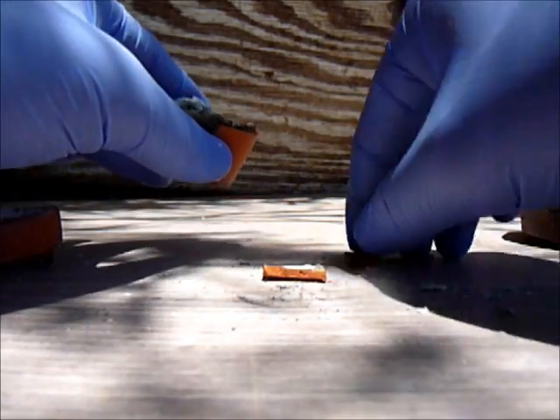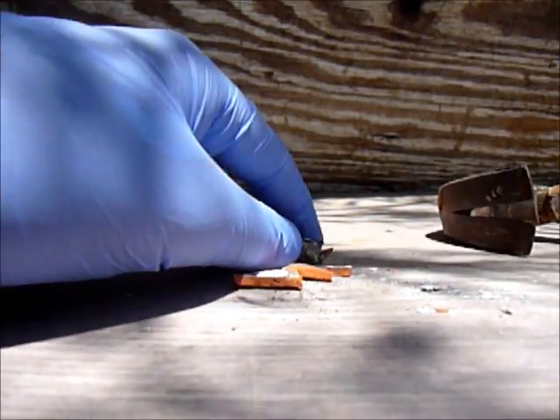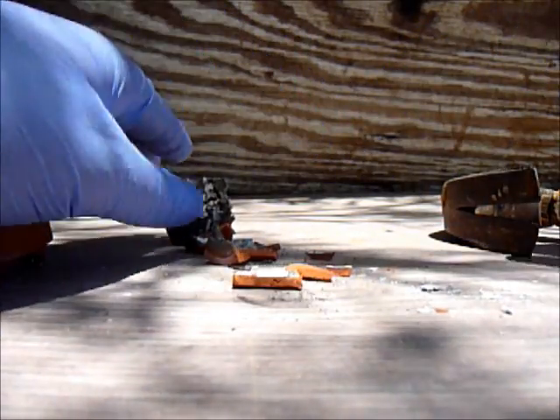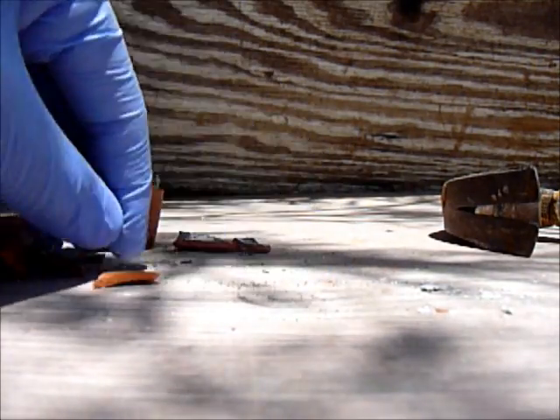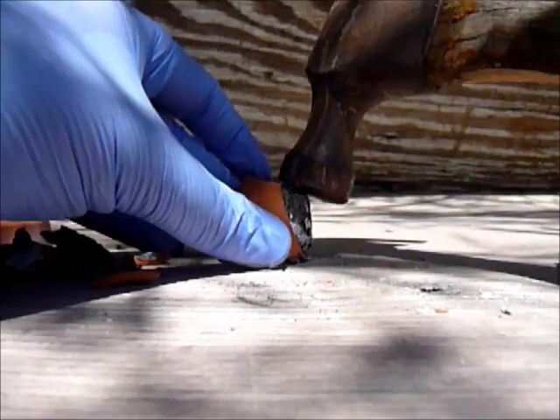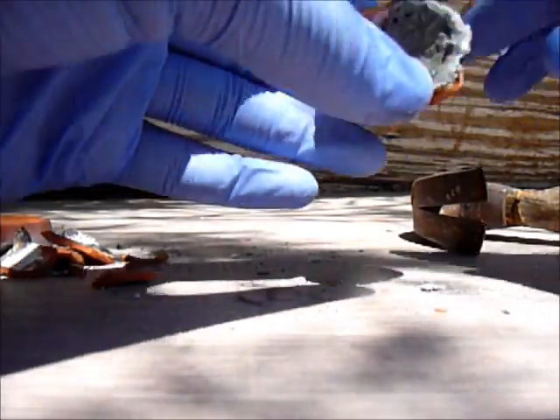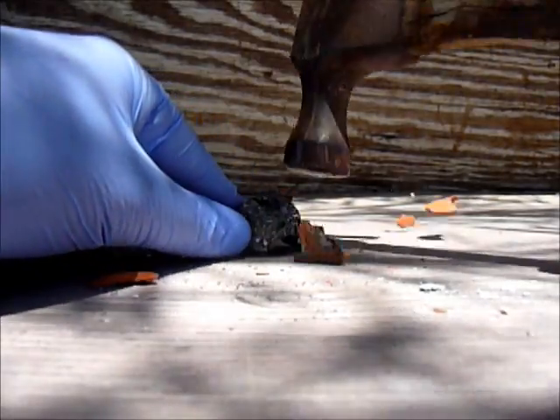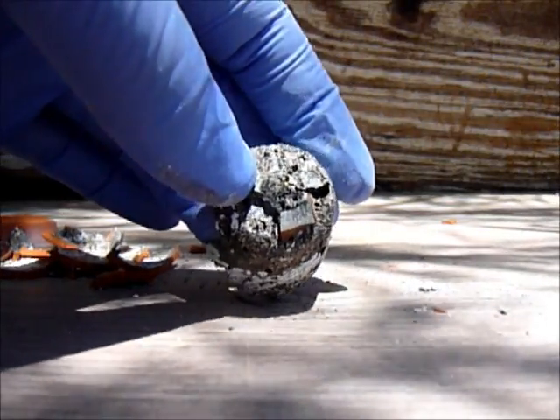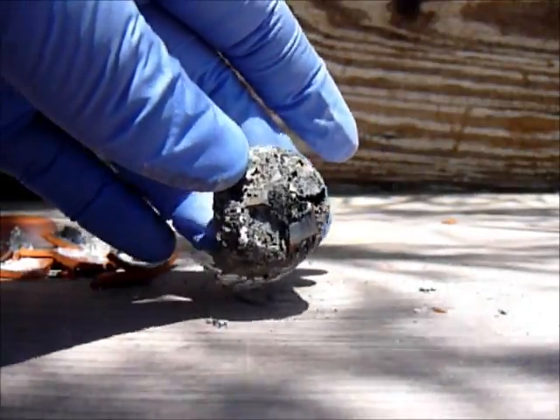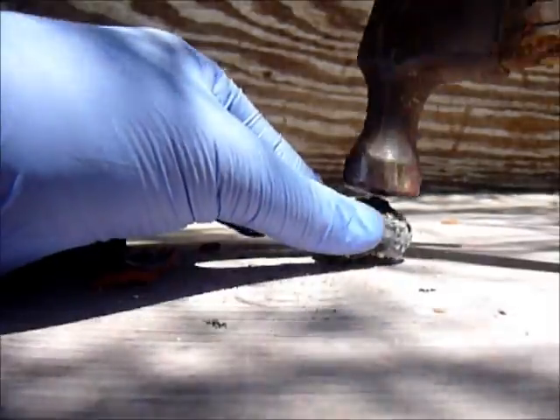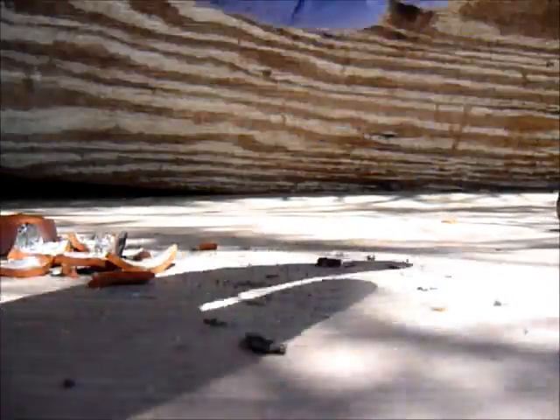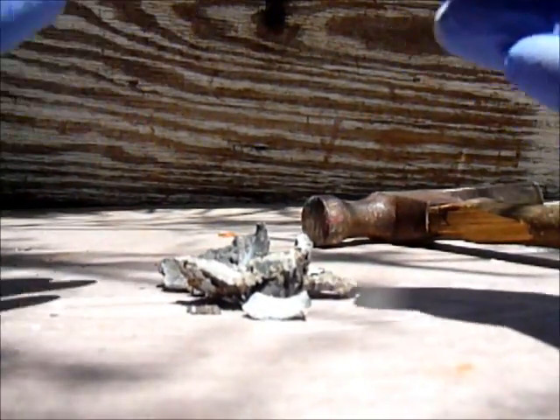I don't want to break all of my pots. You can actually see it sparkle, probably not on the camera, but I can see it sparkling. Put all of that aside and this is what I recovered.